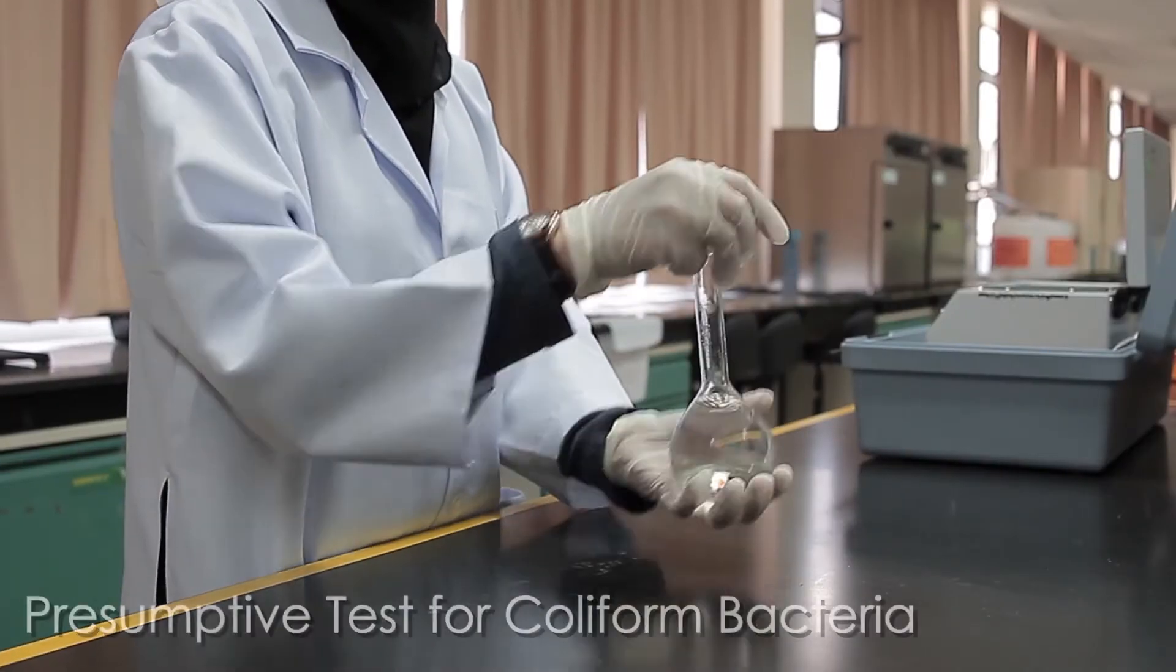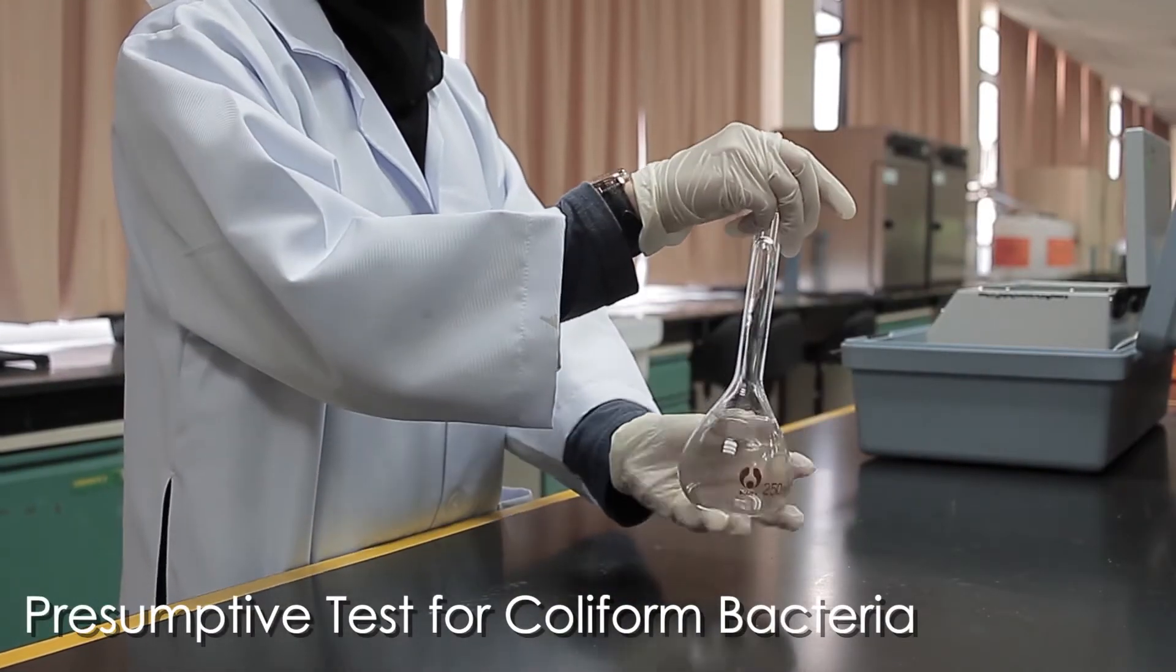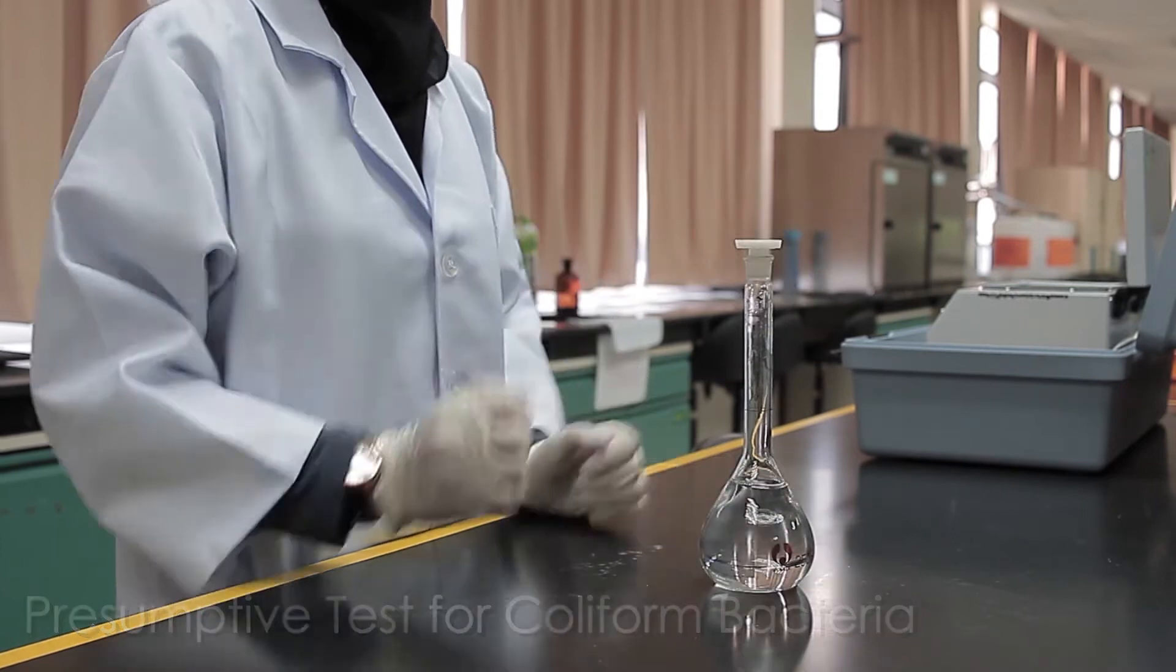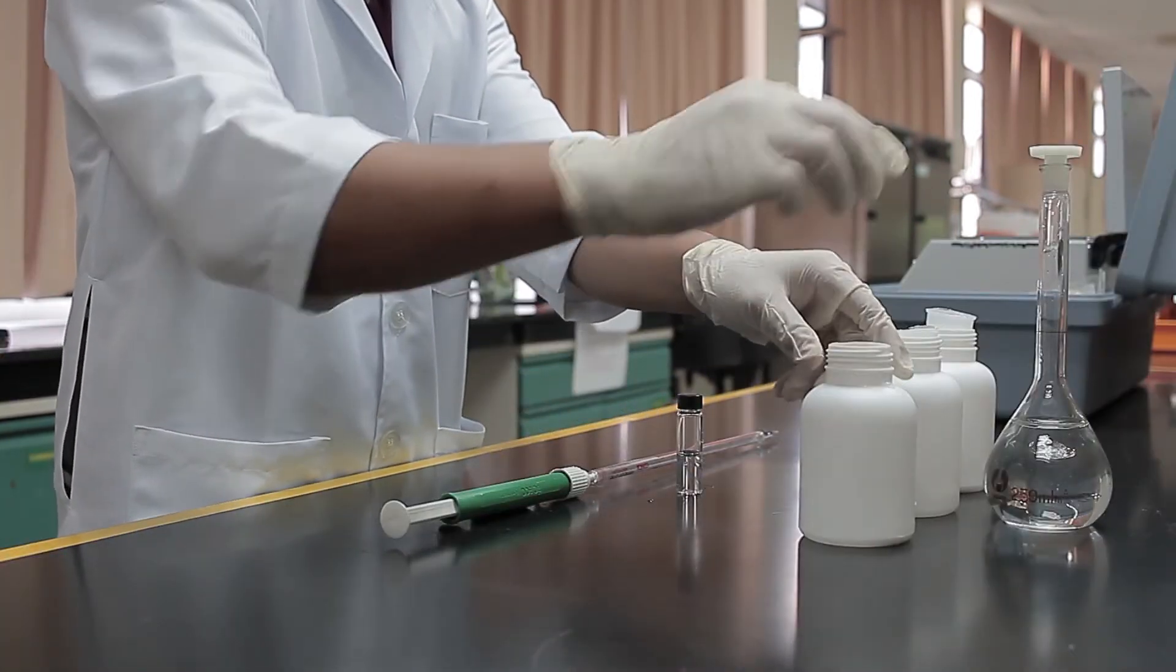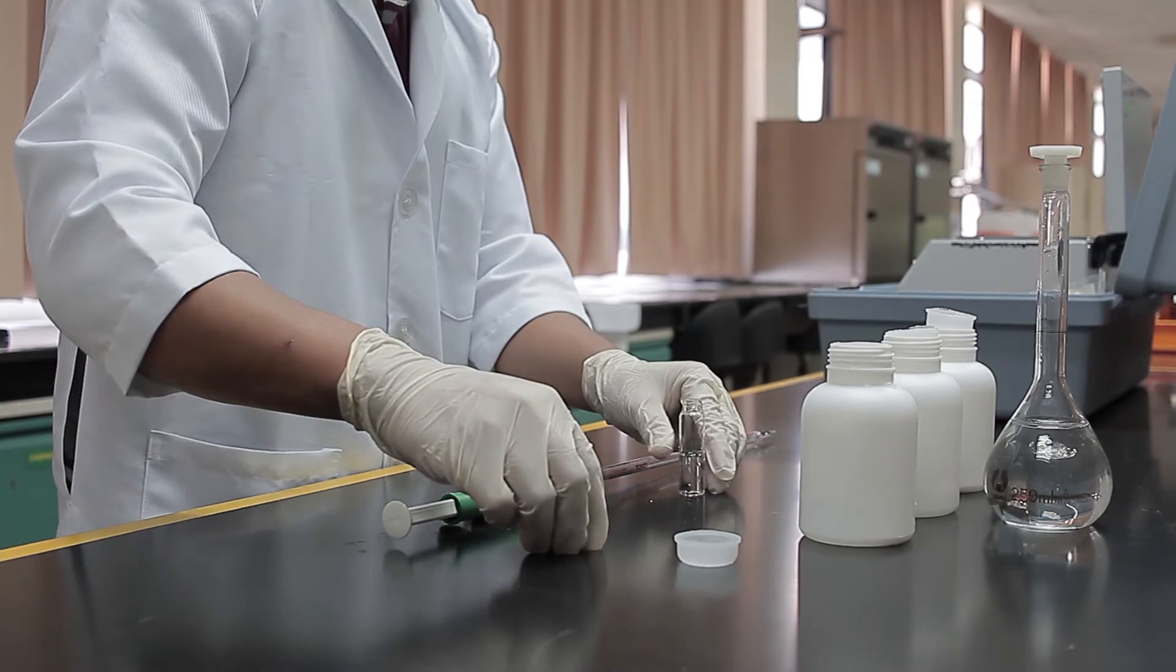Invert the prepared sample for 30 seconds to make sure that the sample is mixed well. Transfer it to a smaller sample tube.